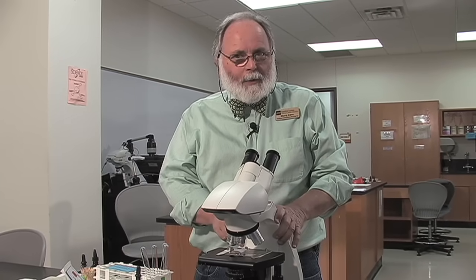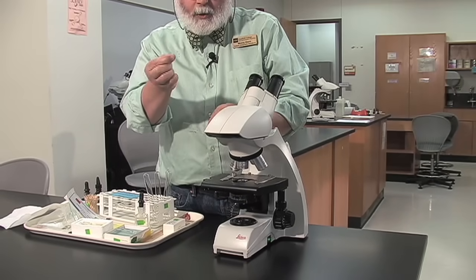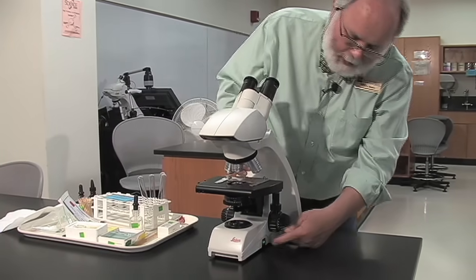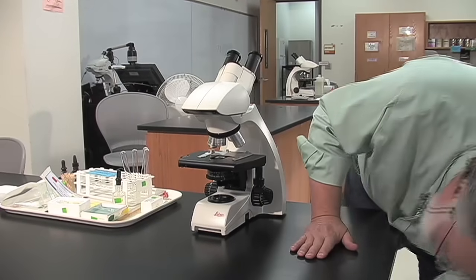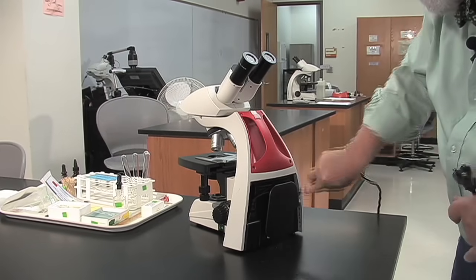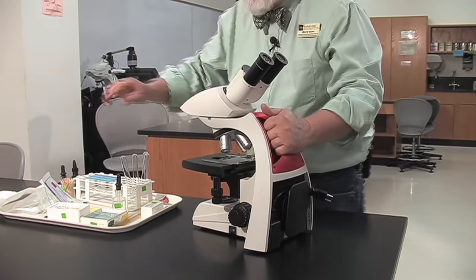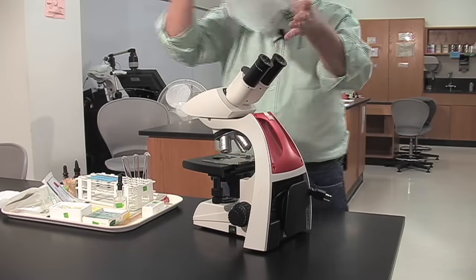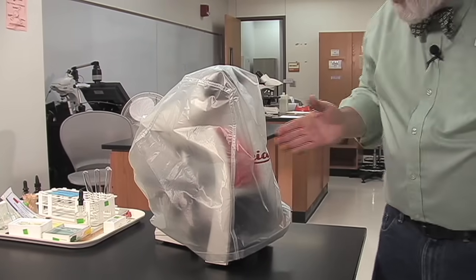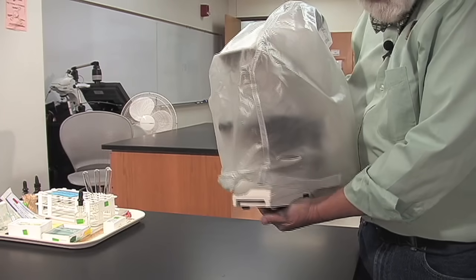When you're through with your microscope, you want to put it away properly. Don't forget to take off your slide. The cover slip is disposable — your instructor will tell you where to put that. The slide should be washed and returned to the slide box. Turn the light off on the scope, unplug the scope, and wrap the cord up. Cover your scope again with a microscope cover. Carry it back to the cabinet — remember, grab by the arm and support from the base. Be aware that the light's been on, so the base may be a little bit warm; you can cup your hand so you don't get burned.